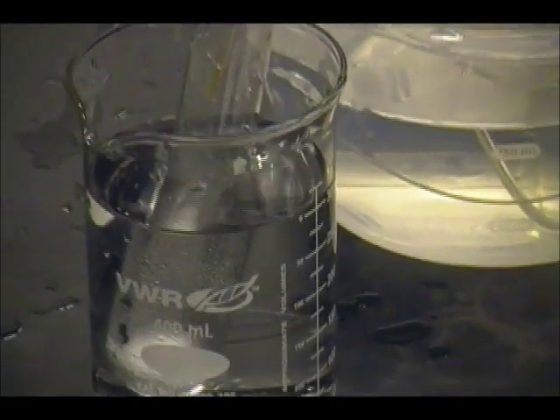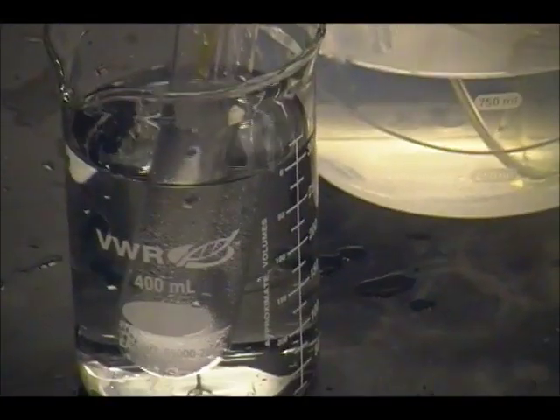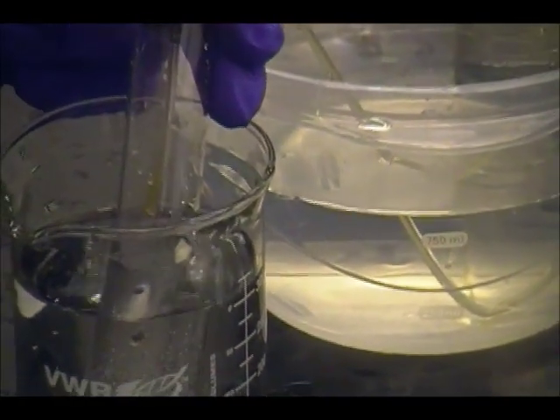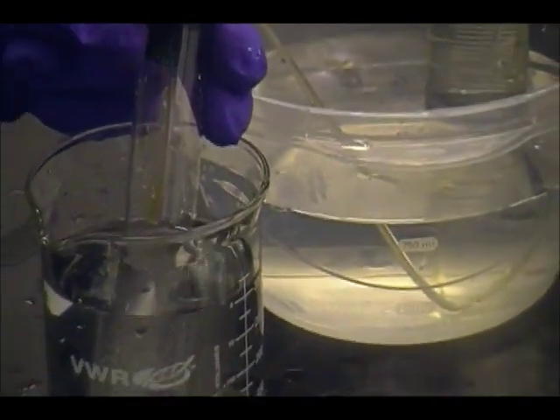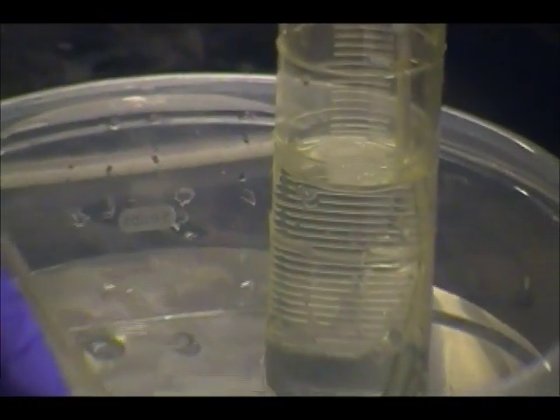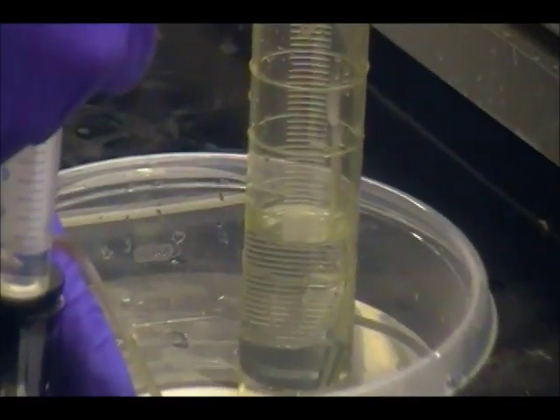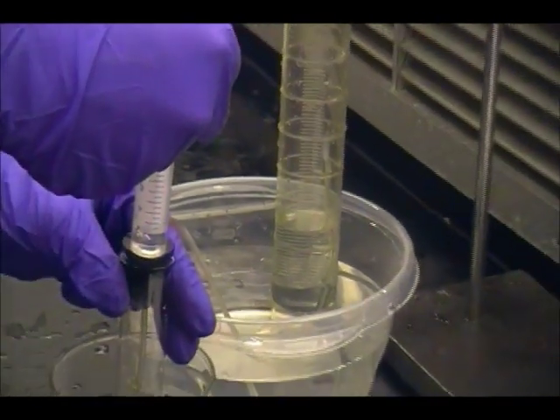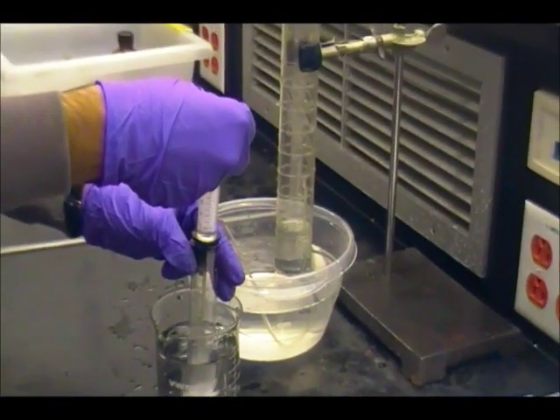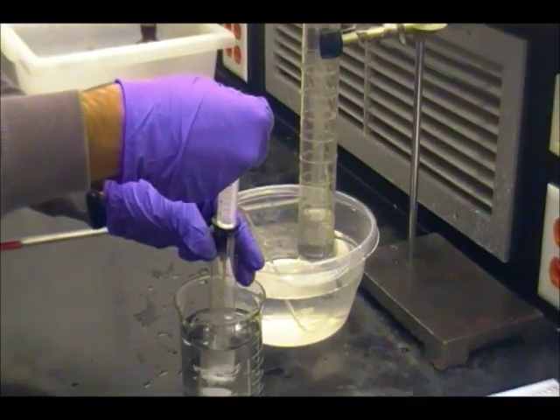The reaction may be completed before all the hydrochloric acid is used, and that's because the magnesium turnings are purposefully used as a limiting reagent to calculate the amount of hydrogen gas produced. And it's important to note that you shouldn't have any solid left over after you have used up all your hydrochloric acid, because the hydrochloric acid you use is in excess. But if you still do have magnesium left at the bottom of the test tube, then something went wrong in your experiment and you will have to repeat your trial over again.